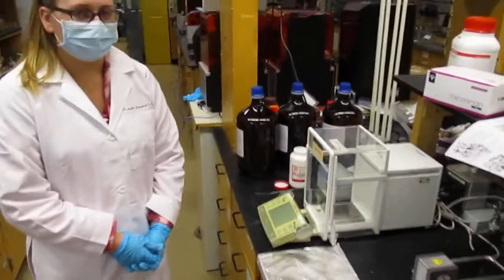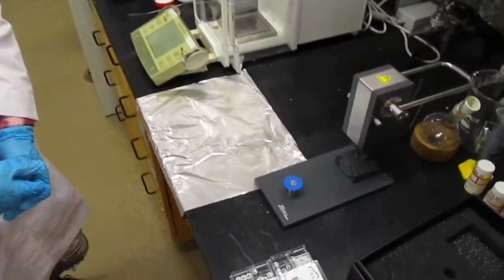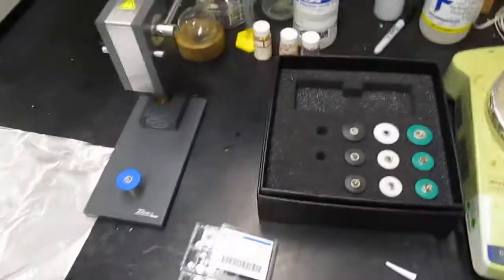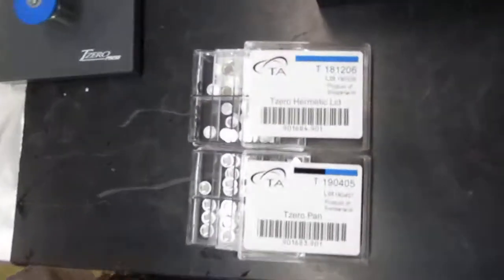This video is on training for the preparation of samples for the DSC instrument. First things first, you're going to need to know what type of pans and lids you're going to use as well as the size.